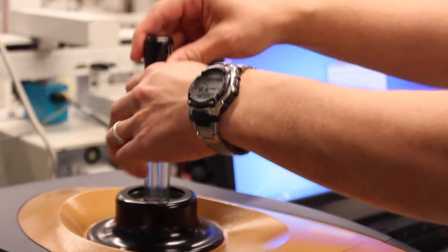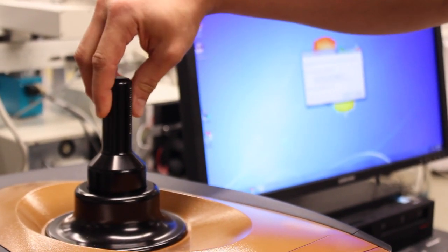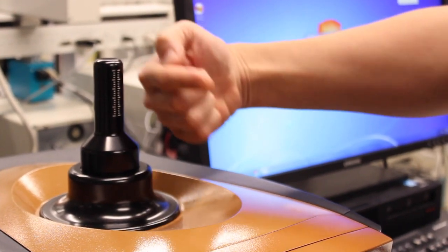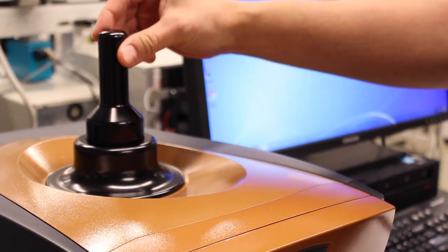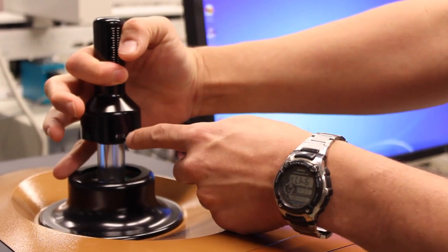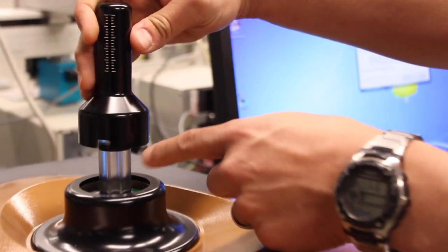Step three is to reinstall the burette handle. To reinstall the burette handle, you need to make sure that the gauge is facing approximately toward the front. It should not be toward the back or the side. There are three little notches that engage three pins.